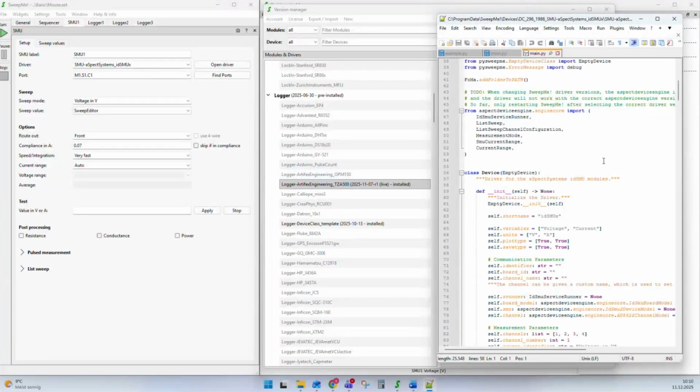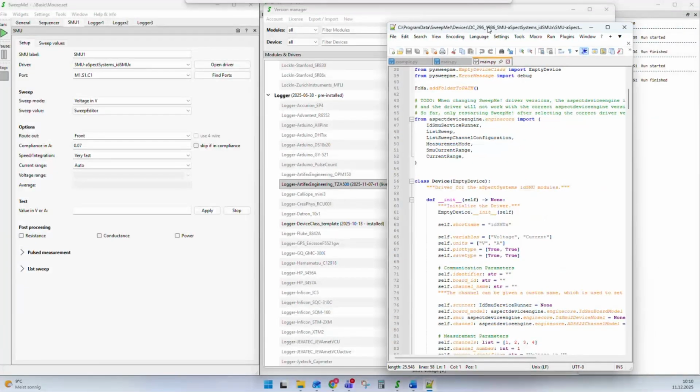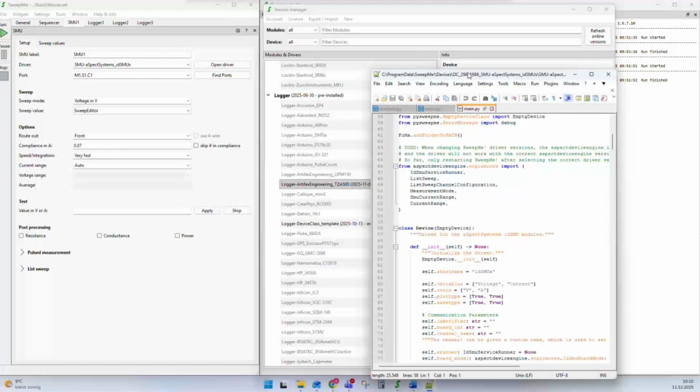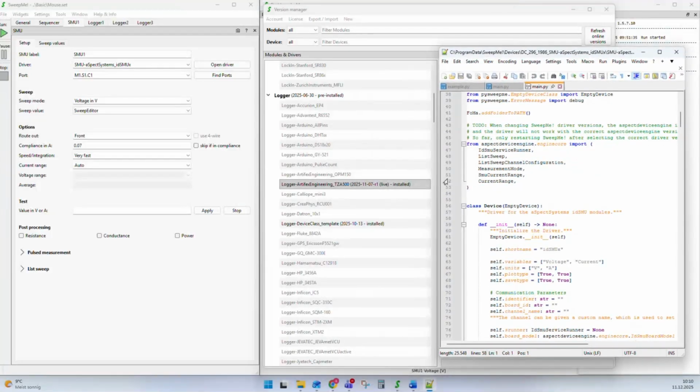Okay, and how can you get such a driver into the system? It is basically possible to add any instrument where you can have code in Python to interface with the instrument. You can add any instrument to SweepMe. And there are different options for how you get a new instrument into SweepMe.